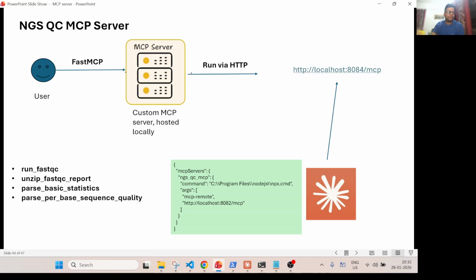For this demo purpose, I have created four tools for the MCP server: run FastQC, unzip the FastQC output, and from the report, parse basic statistics and parse per base sequence quality. These are the four basic functionalities it does.